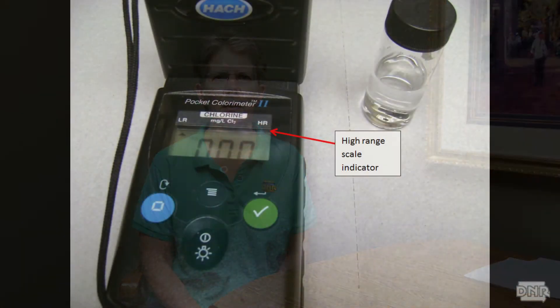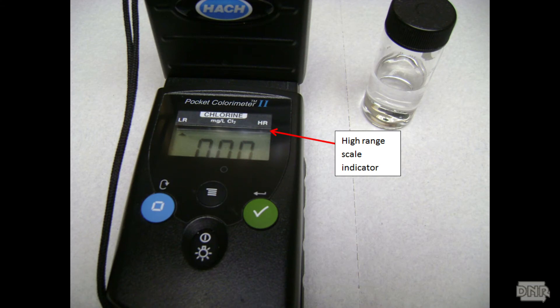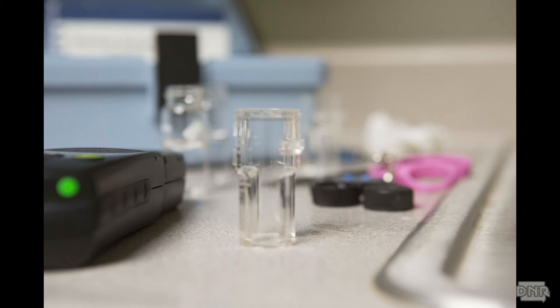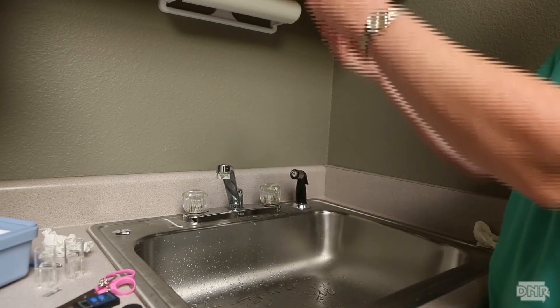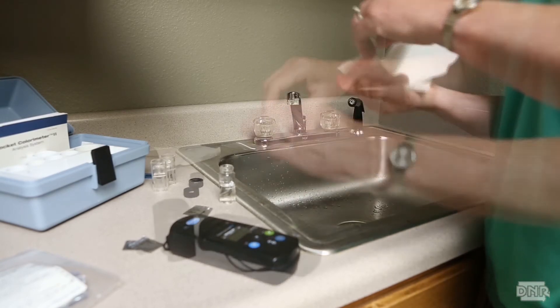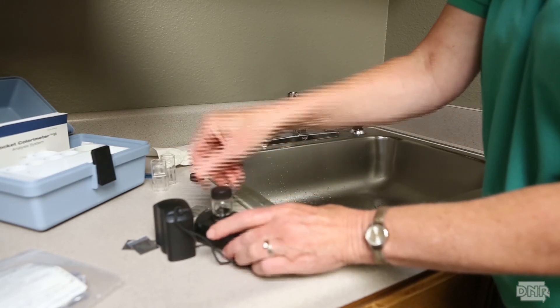In these situations, you must dilute or use the high range scale. To use the high range scale on the Hach Pocket Colorimeter 2, you must change the scale. Use the plastic vials with the indented sides. Use 5 ml of sample and 2 reagent packets. To measure free chlorine on the low range scale, fill the sample to the 10 ml line. Wipe the vial and place the vial in the instrument. It is very important to line up the mark on the vial with the mark on the instrument. It is important to always line up the vial in the same orientation so you measure across the vial in the same way.